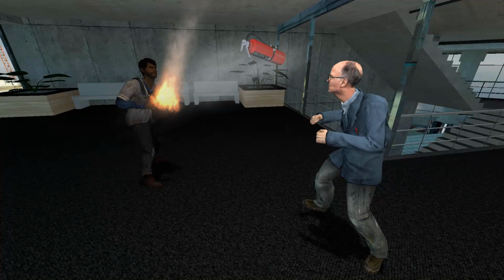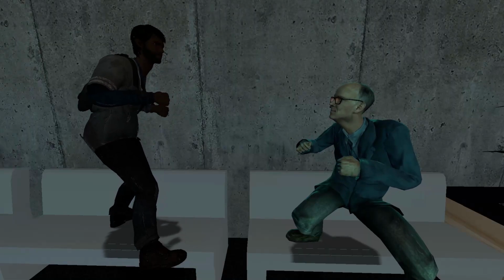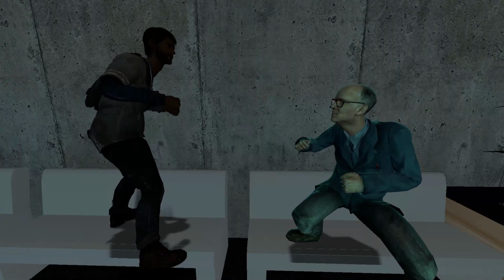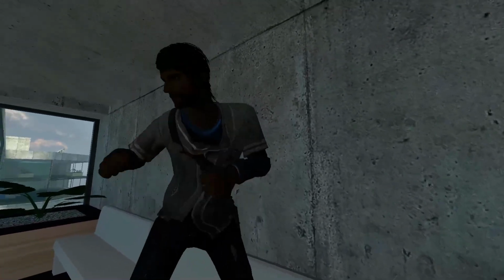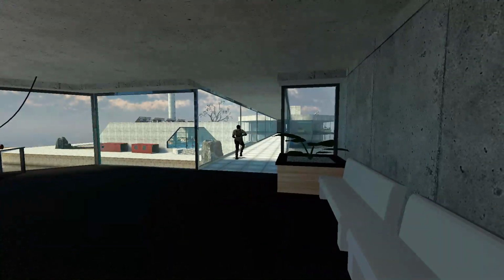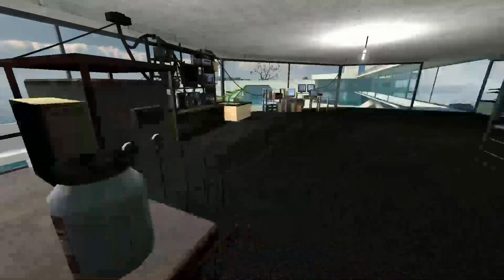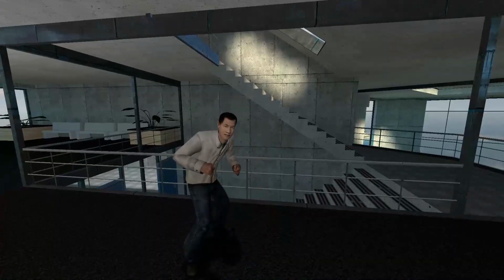That feels so much better, dude. Hey, Gabe, next time, you should wear a lab coat and not have baggy clothes because you can set a fire with a Bunsen burner. Go change into a scientist outfit, sir. Alright, I'll be right back, guys. Guys, I'm back. I got proper clothing. What's up? You don't have eye protection. Chemicals can get in your eye.